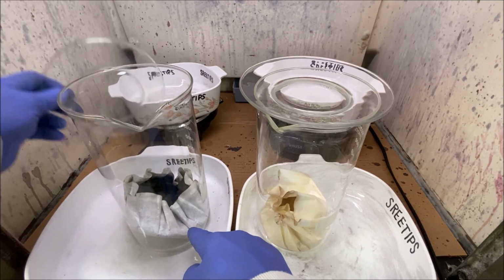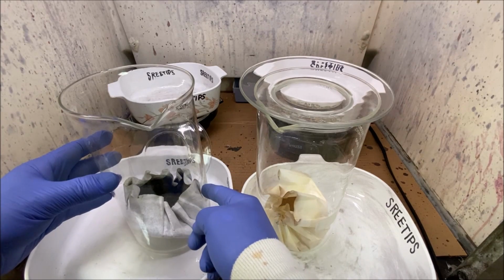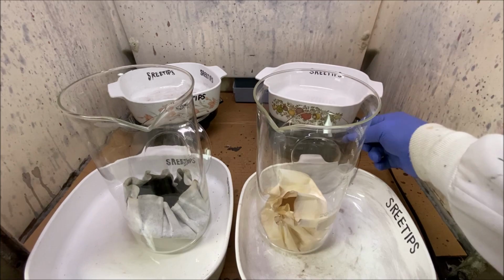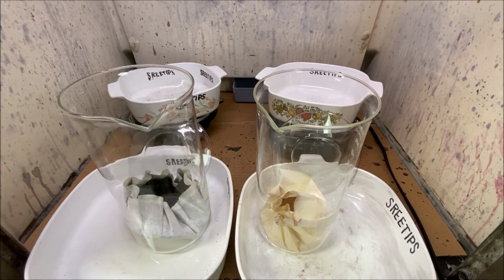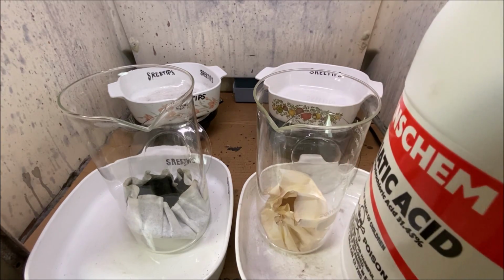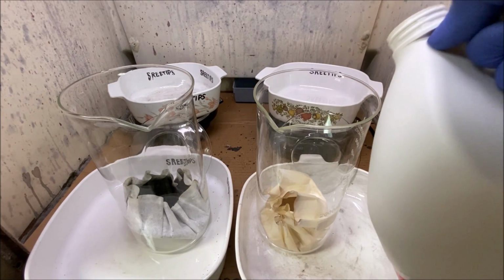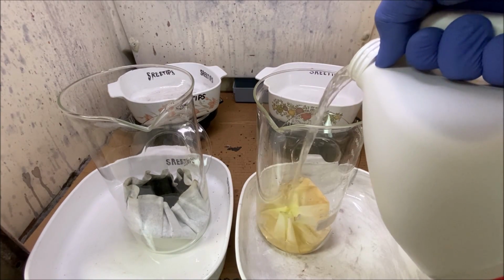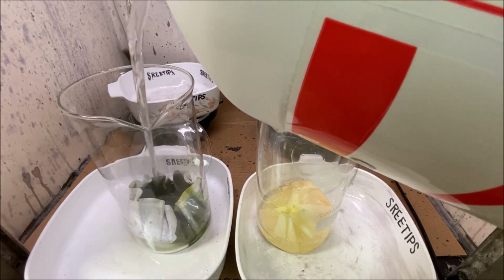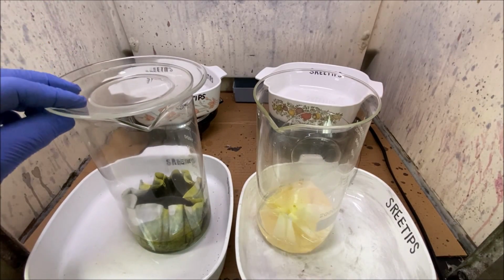These are the solids that we extracted all the silver out of. There are going to be some platinum group metals in here, and gold. This is the precipitate that we rendered with DMG from the silver solutions. What I'm going to do is add some hydrochloric acid to each of these beakers now, just a couple hundred milliliters, and we'll cover them up and put them up on the heat.